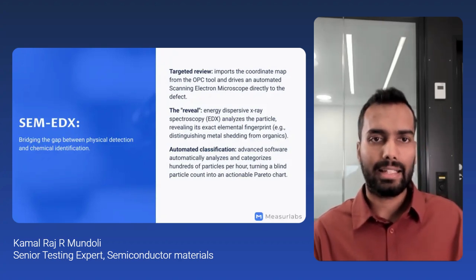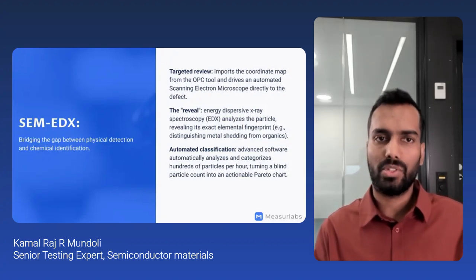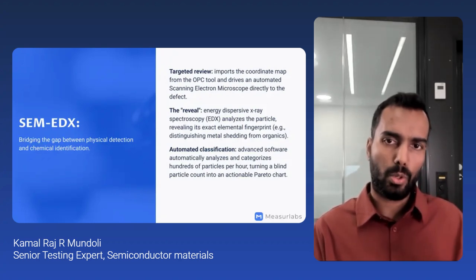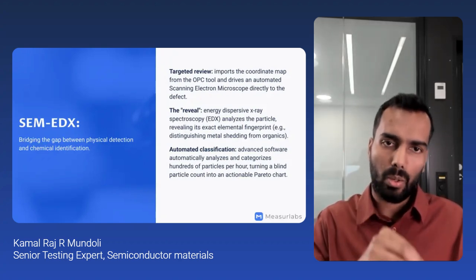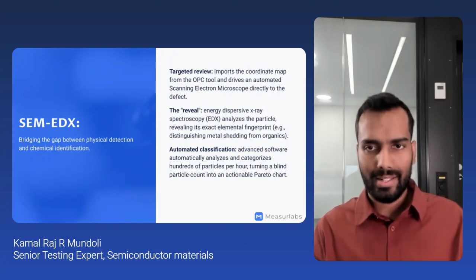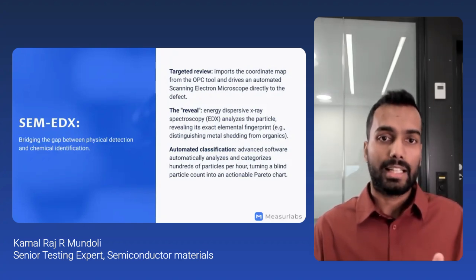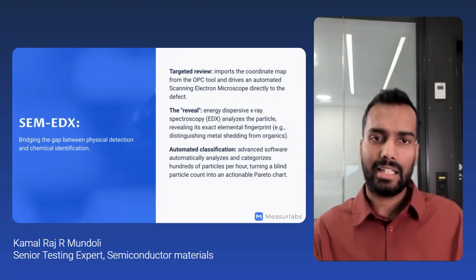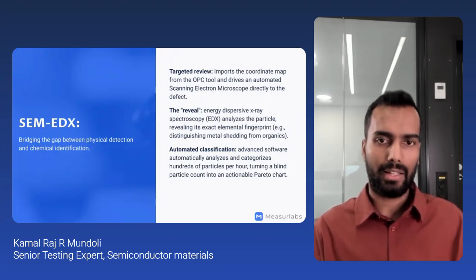Instead of blindly scanning the wafer from scratch, the tool imports the exact coordinate map generated by the optical particle counting tool. The automated scanning electron microscope then drives the stage directly onto those specific defects. And once we lock onto the particles, we reveal what is in them using energy dispersive X-ray spectroscopy, or EDX. So the electron beam excites the particles, revealing their exact elemental fingerprint. This allows us to easily distinguish between a metallic shedding from a robotic arm versus a carbon-based organic flake.